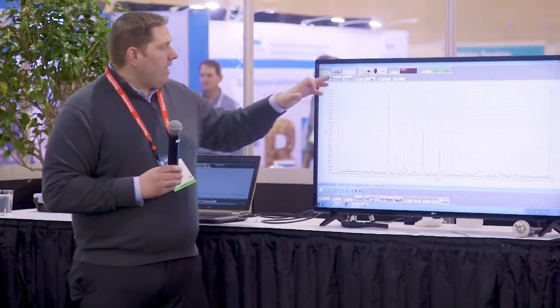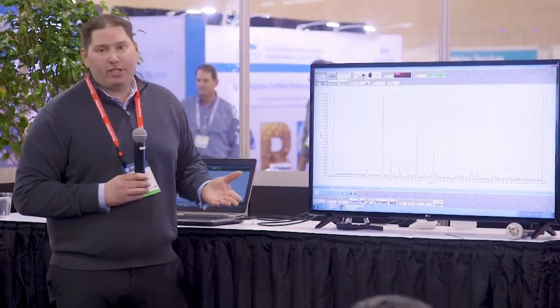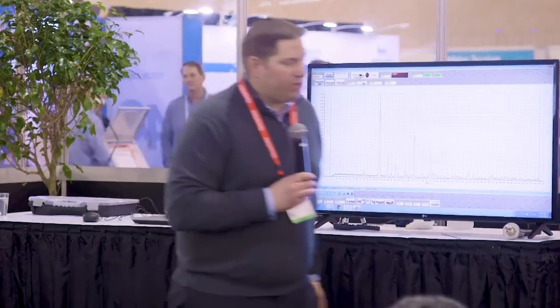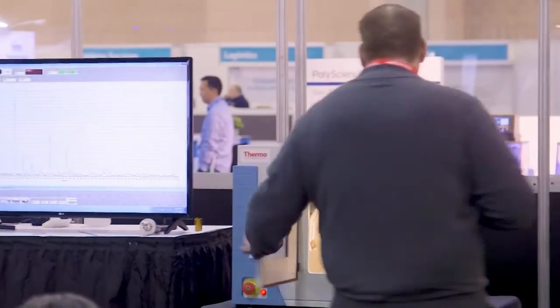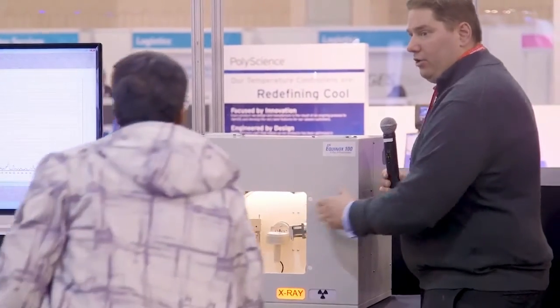This was yttrium oxide that I used to make sure that the system is aligned, because it has peaks high and low throughout the entire spectrum that I know of. So as you can see now, we have everything in here. There was nothing I had to change. All I had to do is basically hit stop and start. The only aspect we can possibly change here is the power of the X-ray tube. This is a 50-watt microfocus source tube. So what we're doing here is a low power tube.